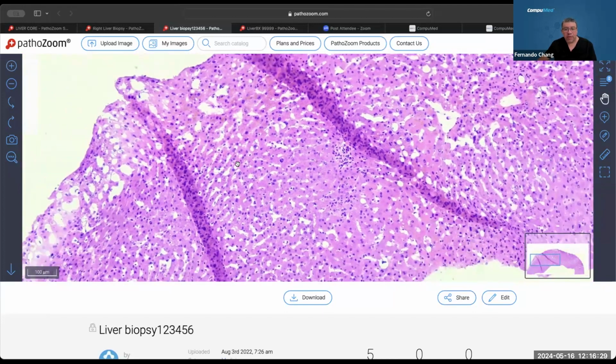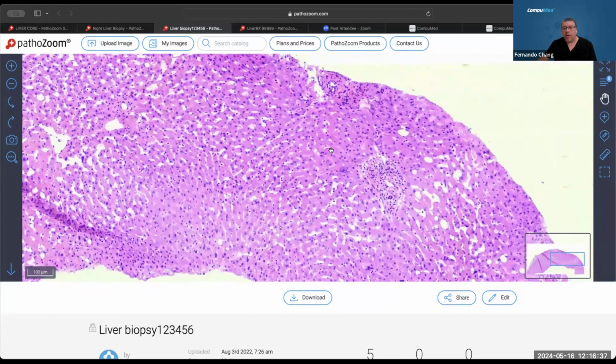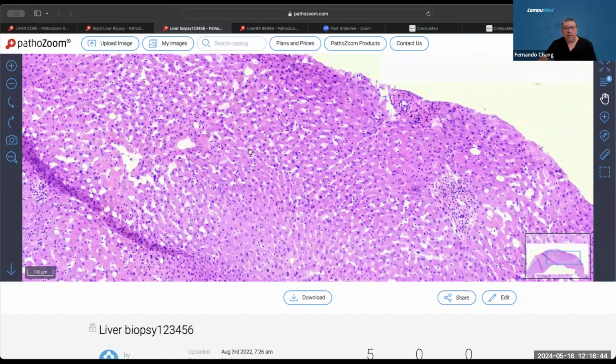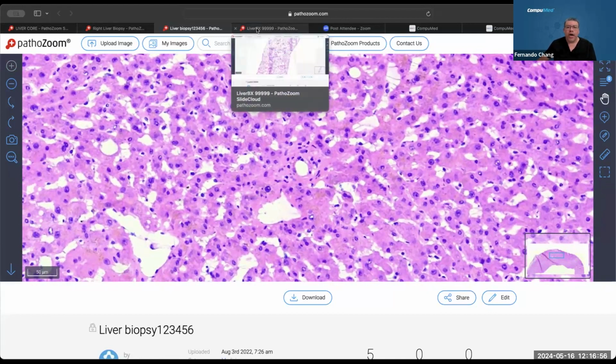Now, did this prevent the pathologist from reading? We can see a little compression artifact around. There's not much, but you can see that. Here, the tissue is more uniform without compression artifact, but you can see that it's around. But if you zoom in more, you can see a lot of this vacuolization of the nuclei, which is also part of the freezing artifact.